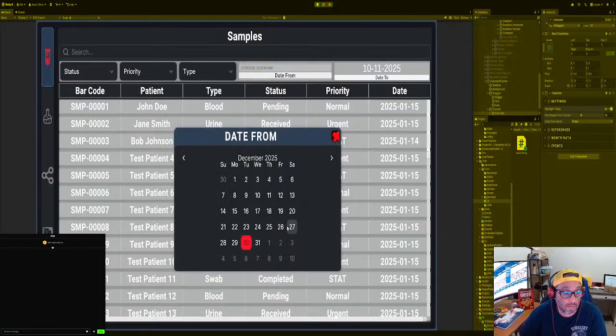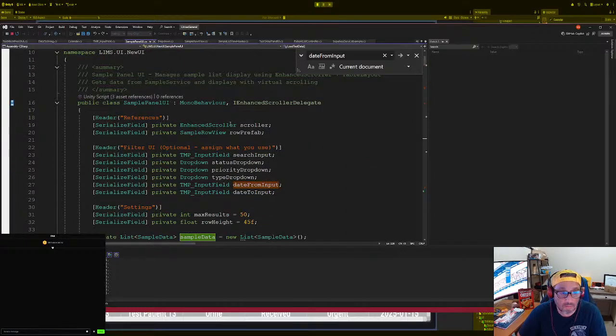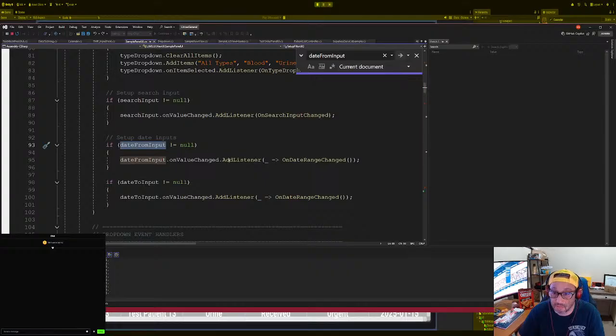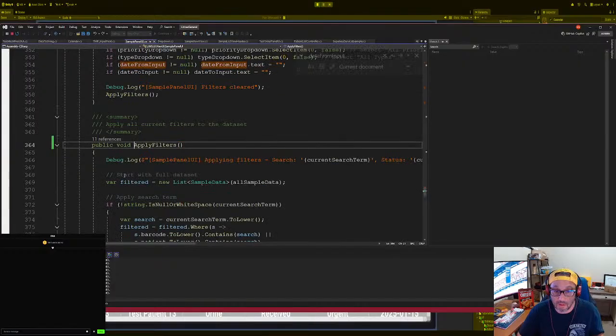Okay, so we could choose from. No, it's not firing it off. Okay. Let me see. Let me make sure. Okay, here we go. All right, so date input, date from input. Sure, everything's date from input is not. We're gonna add a listener, which is the date range, right? Which is good. Which is applied filters. Oh, I see. I see why. Apply filters.